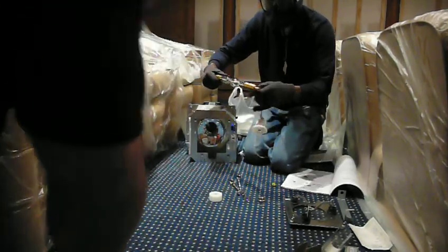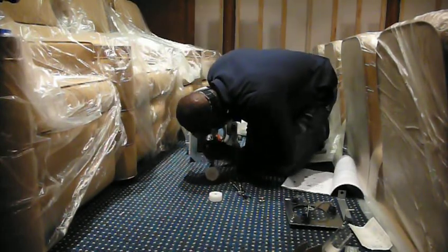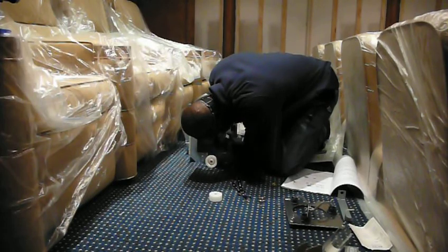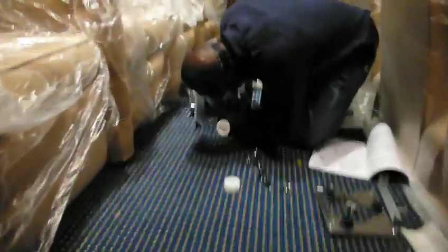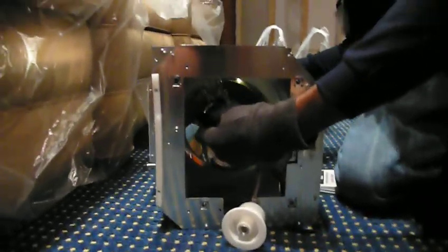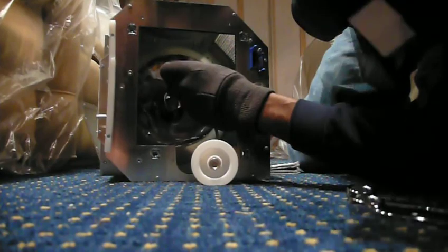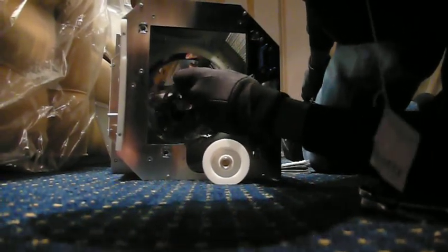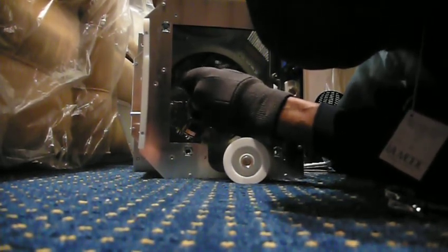Now I'm going to install the lamp, inside the lamp house. Now I'm going to get my mask off — I can't see. There's a lot of stuff in there. Hold on. So the mask is no good?